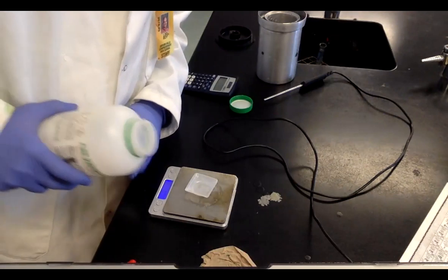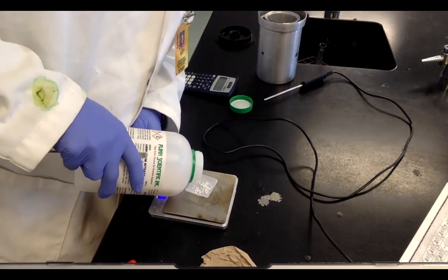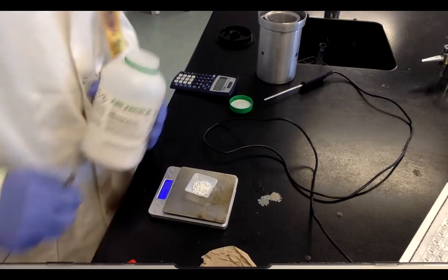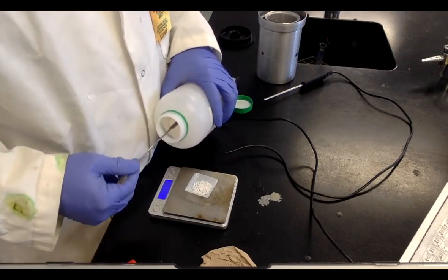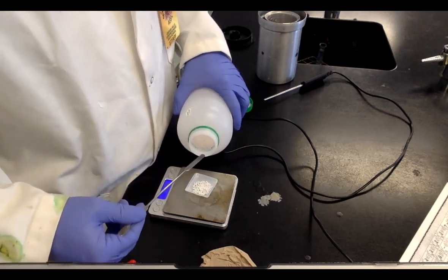It's reading 0 grams right now. Watch me make a mess here. We're at 1 gram, 1.79. Can I even scoop these? Oh man. 1.3. Yeah, 1 chunk at a time. Good. Not even 1.